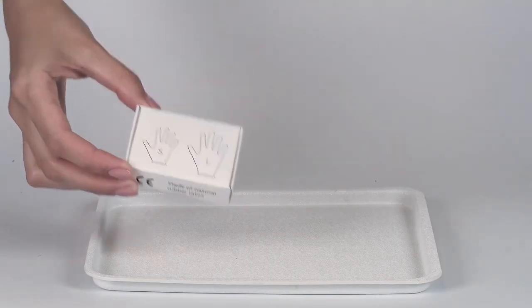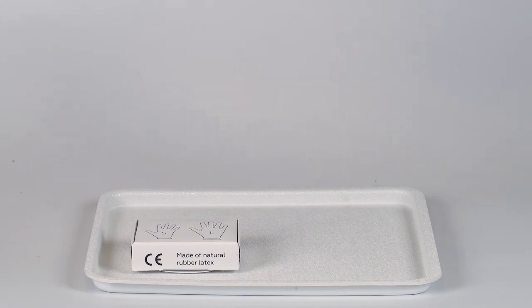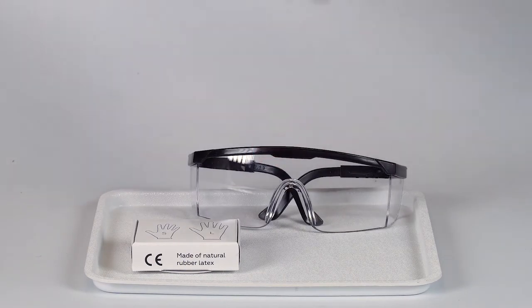Perform this experiment on a plastic tray to contain any possible spills. Don't forget to put on protective gloves and goggles before doing the experiment.